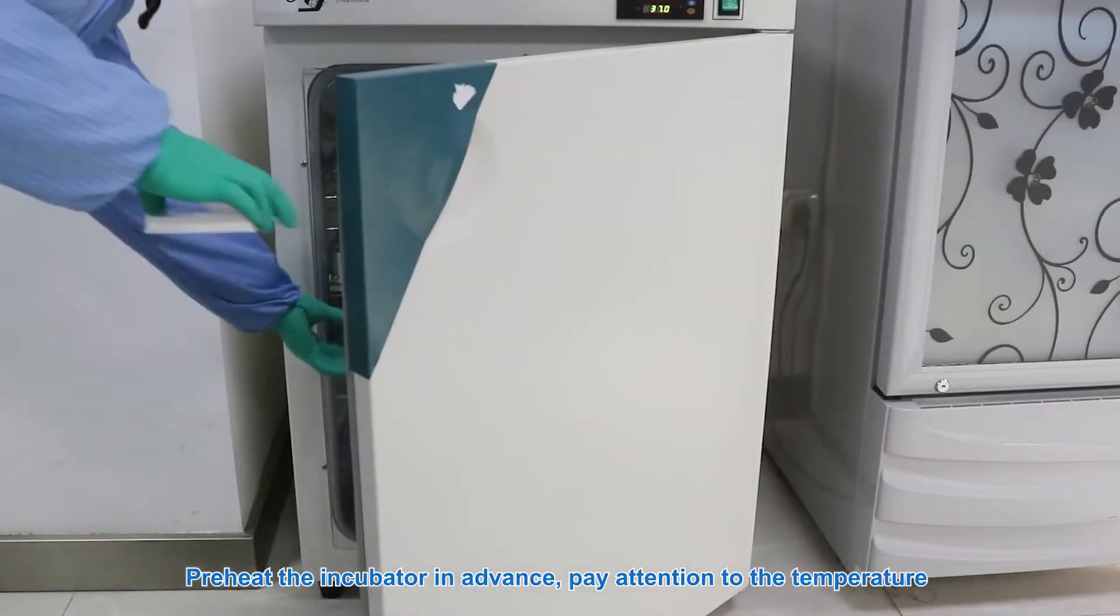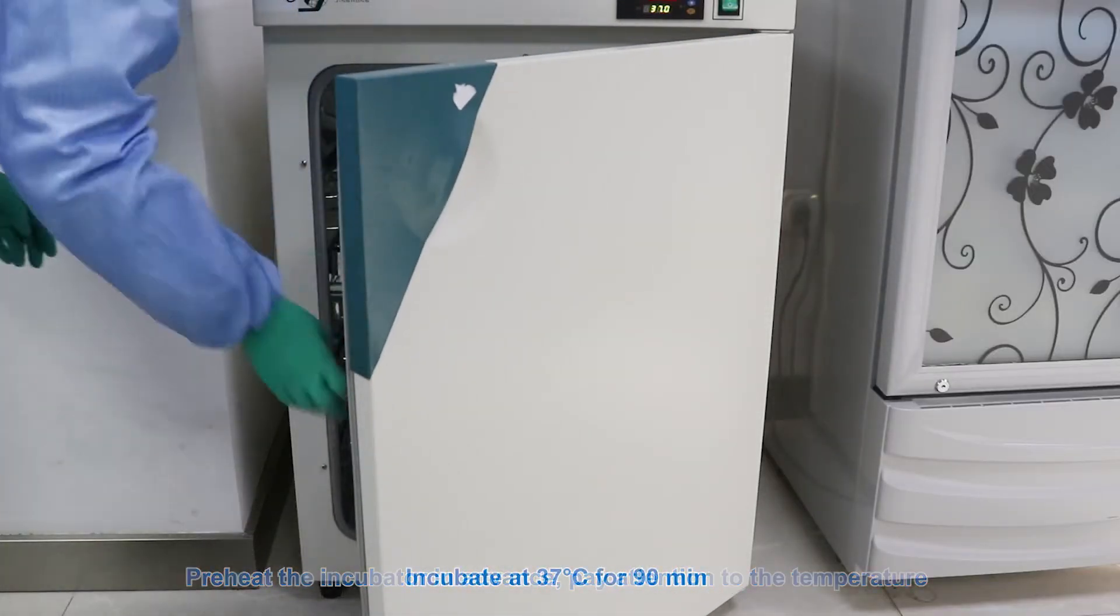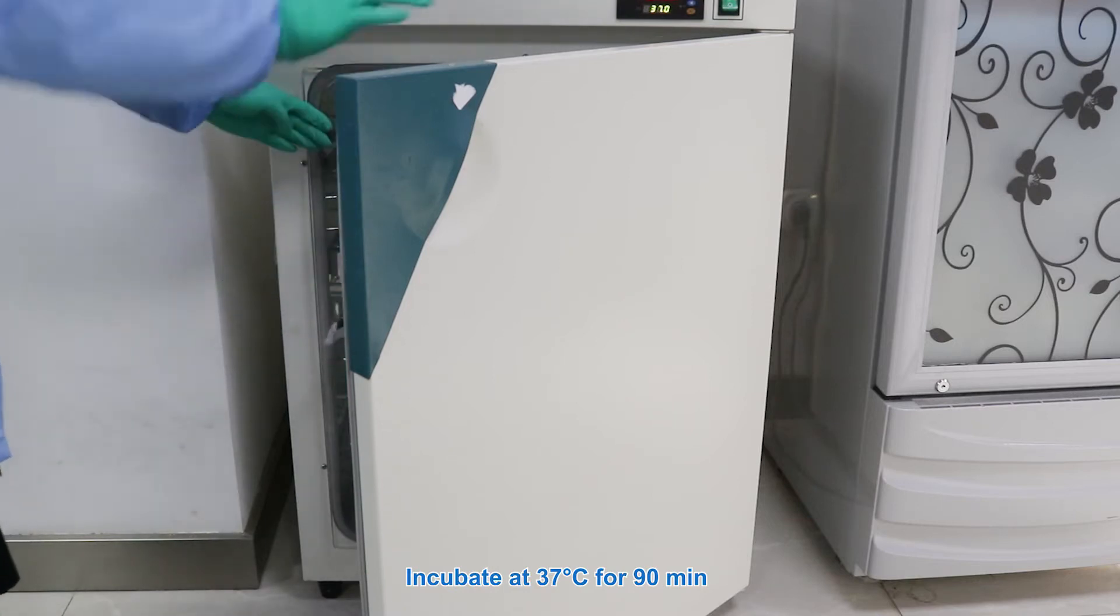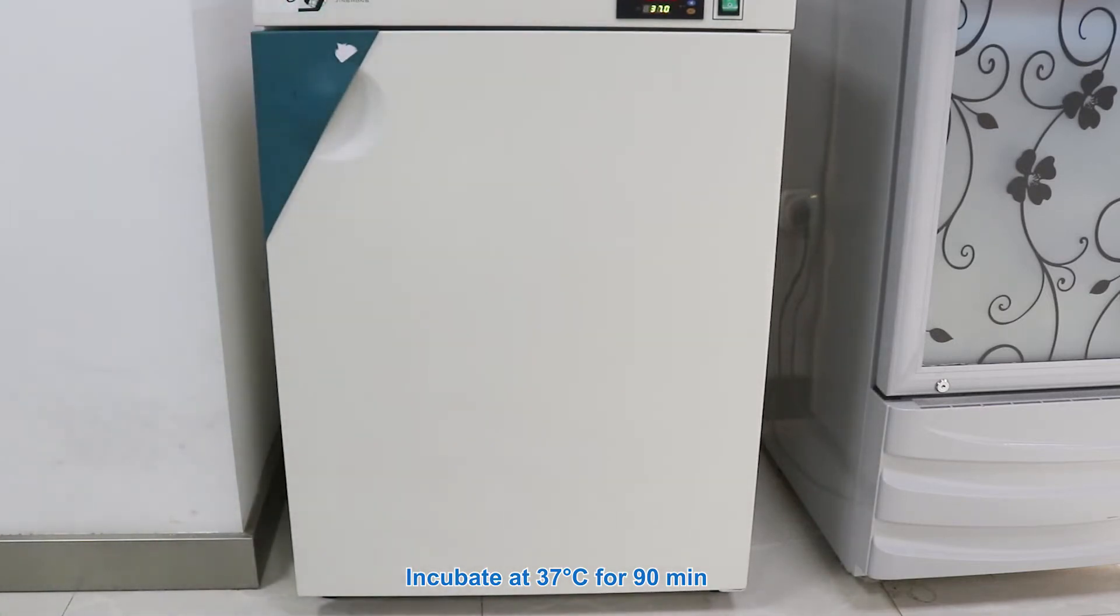Preheat the incubator in advance, pay attention to the temperature. Incubate at 37 Celsius degrees for 90 minutes.